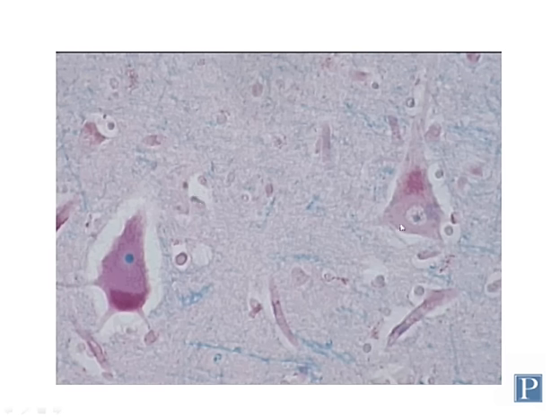Here's another image. Here you can see two pyramidal neurons. Here's one on the right, here's one on the left. They don't always have that classic pyramid shape. This one here to the left is a pyramidal neuron, but it's got some rounded features to it. You can observe here they have multiple dendrites. There's a couple at the basal surface and an apical dendrite.